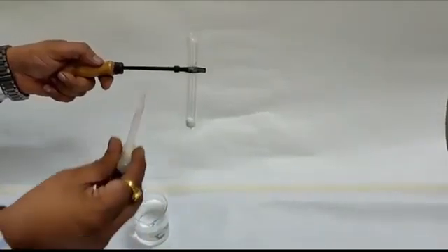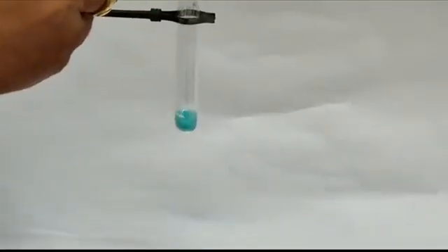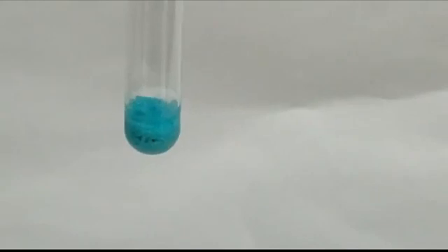Now, let's add a few drops of water to this test tube and observe the change, and afterwards note it down in the table.